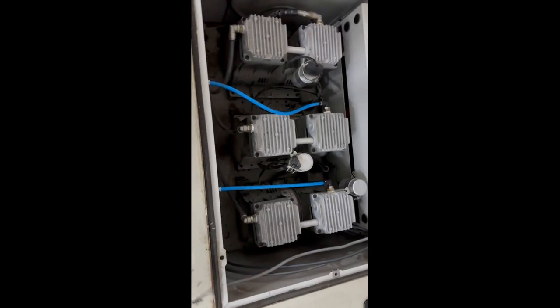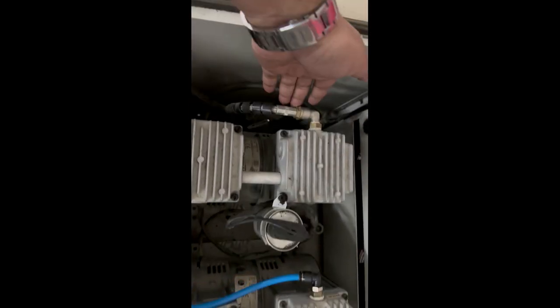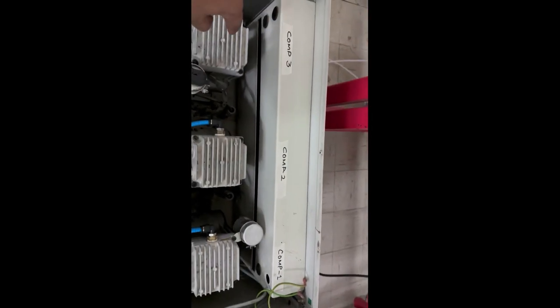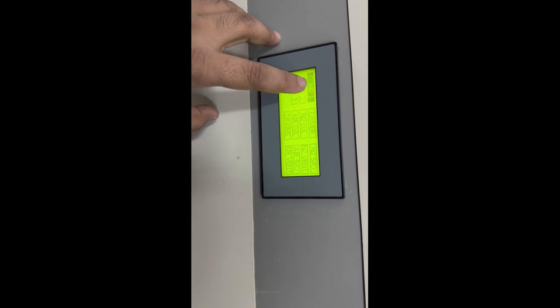Now I found some cables and pipes leaking, and I replaced this fitting with a simple pneumatic fitting, just in order to check the behavior of the system. I also have marked compressor 1, compressor 2 and compressor 3, and now I'm in manual diagnostic mode, and I have just turned on compressor 1, and now I'm checking at what speed I am getting this pressure. I will check all 3 compressors one by one with respect to time, and it will help me to diagnose the problem.